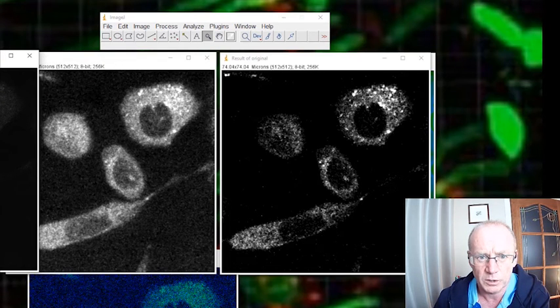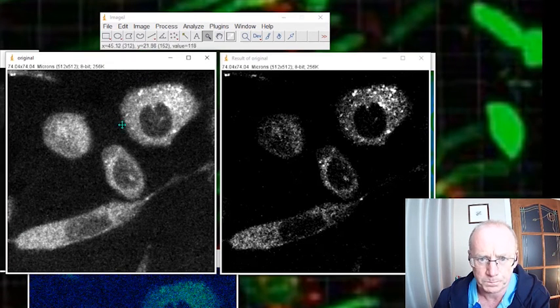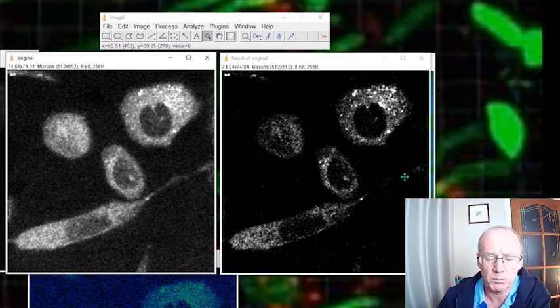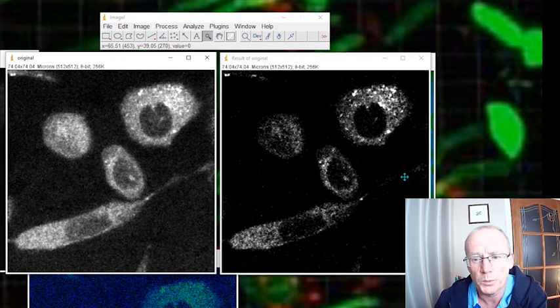We removed the background here and then did some low pass, but here is a more severe background reduction because we adjusted the background image before making the image subtraction. Okay, that may be of use in some cases, maybe not. Hope you like that one though.